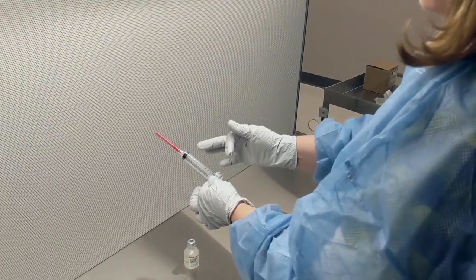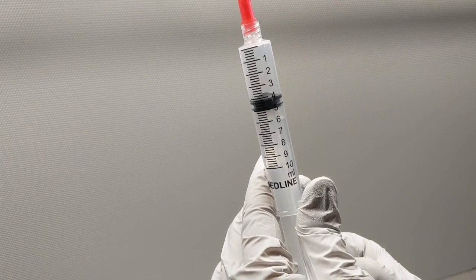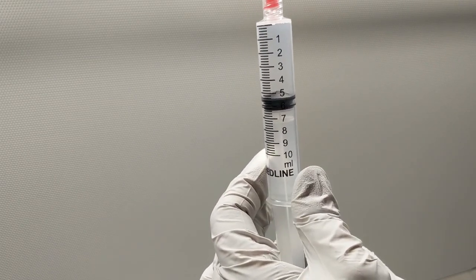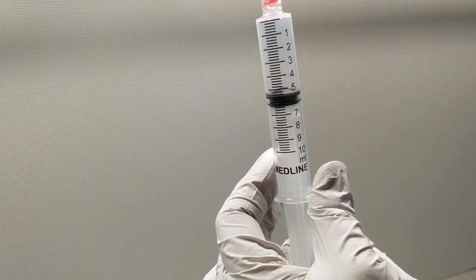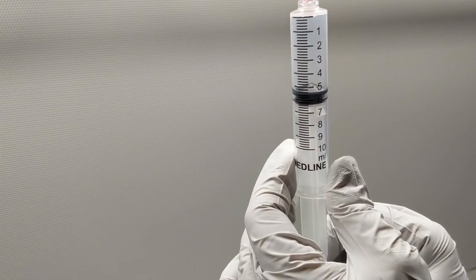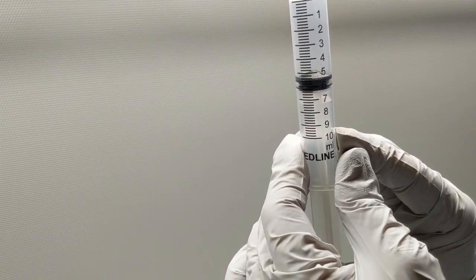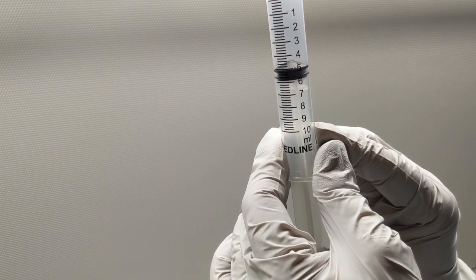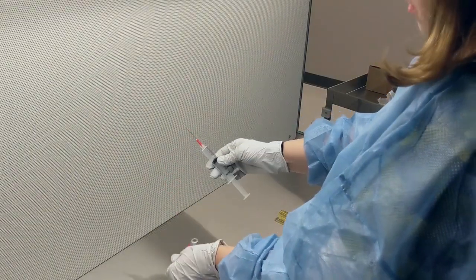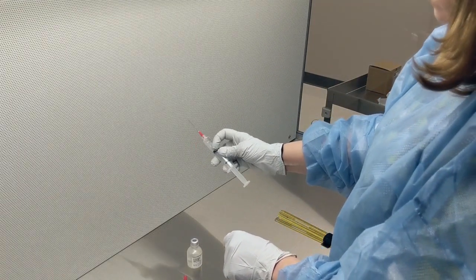So the fluid can come out into the syringe. You want to pull your stopper back to 5ml. I'm going to pull it a little bit beyond 5ml to make a point here. If you note, the top is kind of cone shaped. You don't want the tip—right now the little point is where the 5ml mark is. I actually want the large circle on the bottom that hits the plastic to be at 5, so I need to push this up a little bit to get it right at 5. Then that will be how I want to draw up the product. Now I'm going to uncap. You can leave the cap in the sterile field because I want to get that back on this needle later.